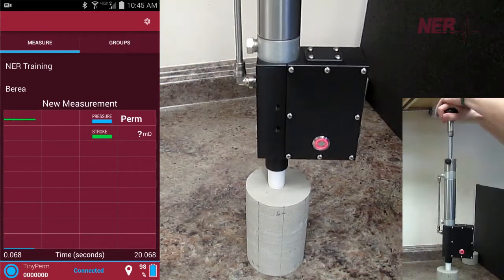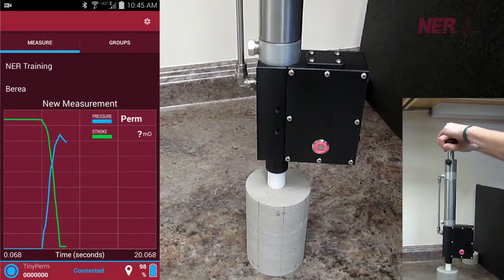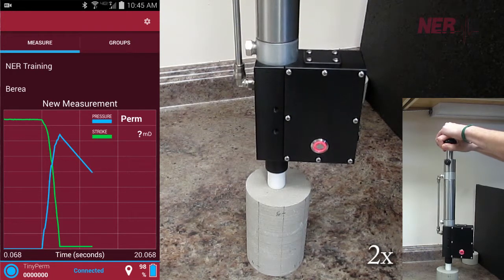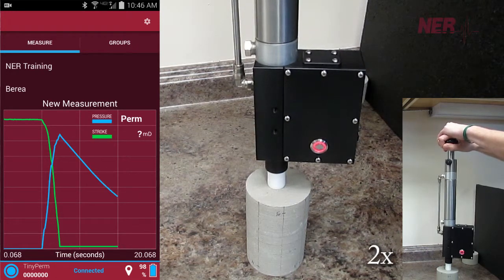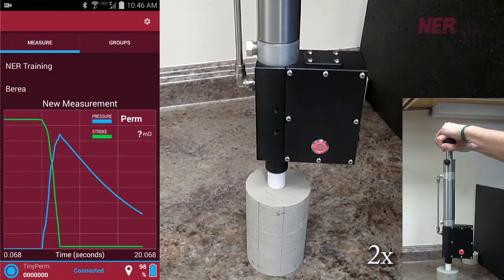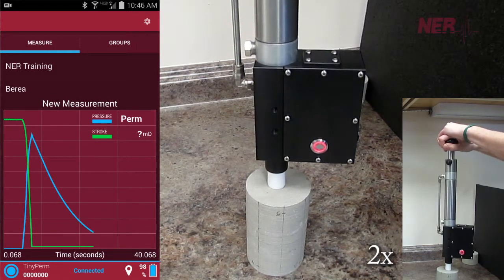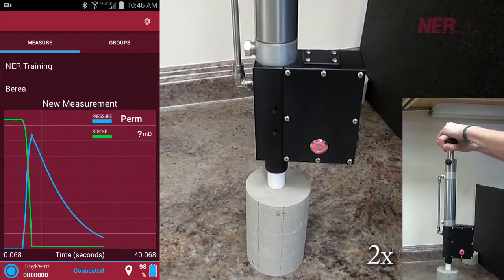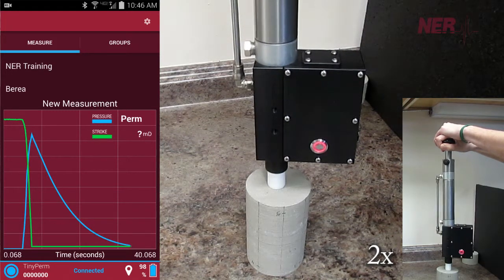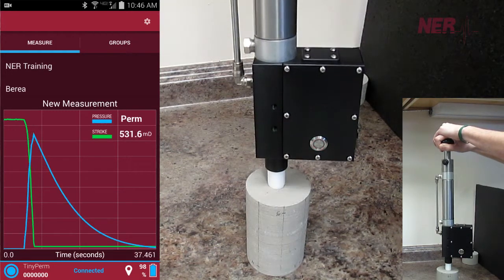As air is pulled from the sample, a microcontroller unit simultaneously monitors the syringe volume and the transient vacuum pulse created at the sample surface. A plot shows the time domain pressure and volume data in real time as a measurement is taking place. A final plot displays this information as well as the computed permeability.